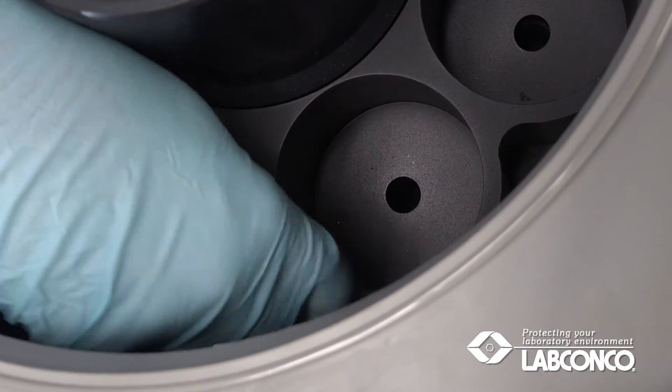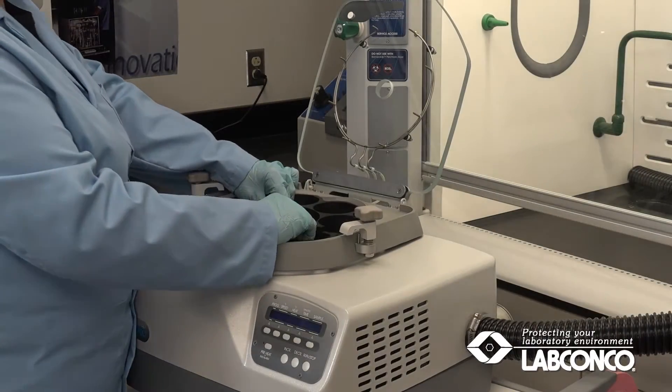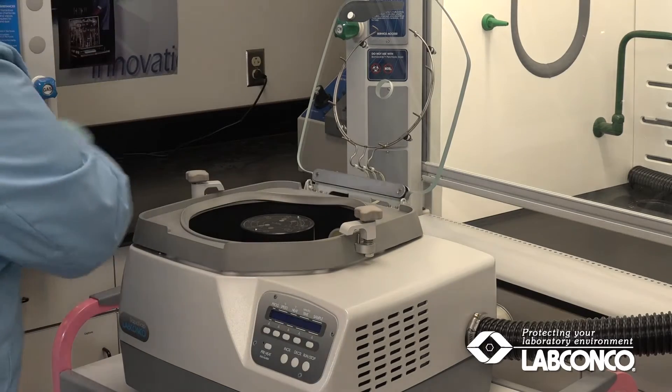The N2 is shipped with the 600 milliliter block. If the 170 milliliter block is preferred, remove the 600 milliliter block and replace it.